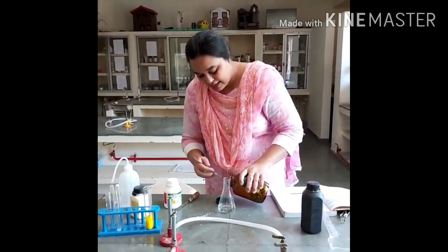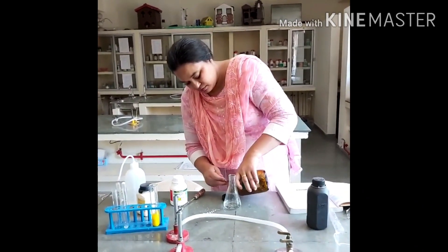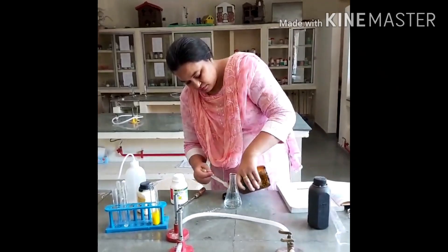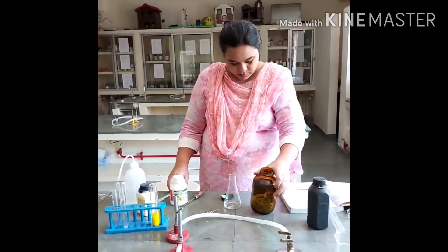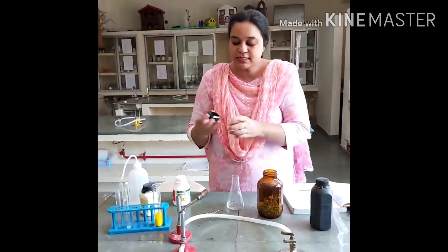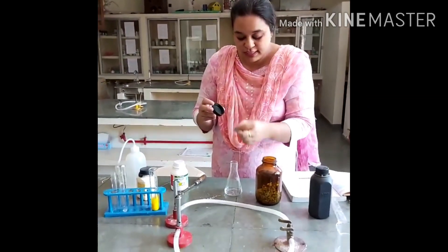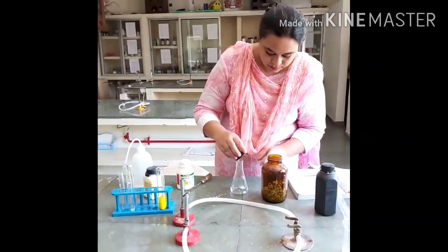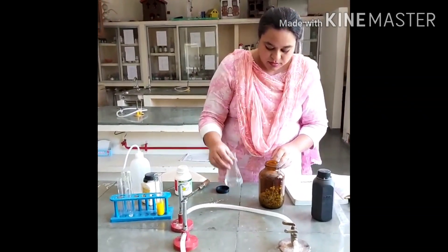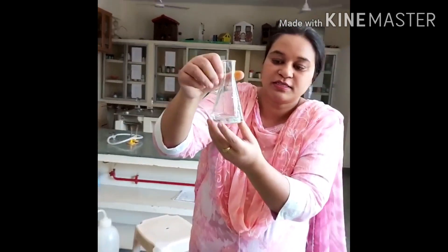These are the zinc granules we have — this is granulated zinc, you can see. I am going to put it in the jar. You can see the bubbles are coming out of it, and these bubbles are of hydrogen gas.